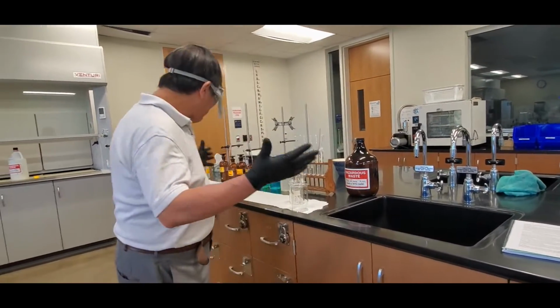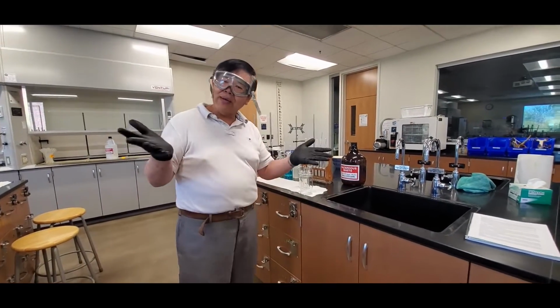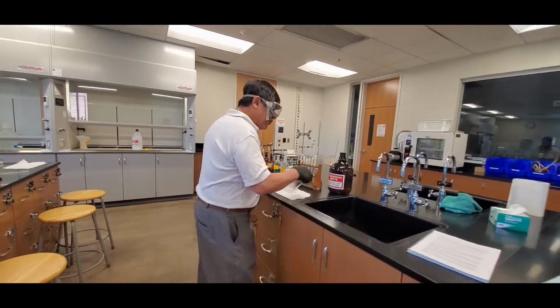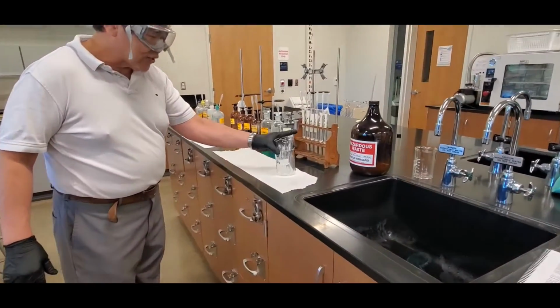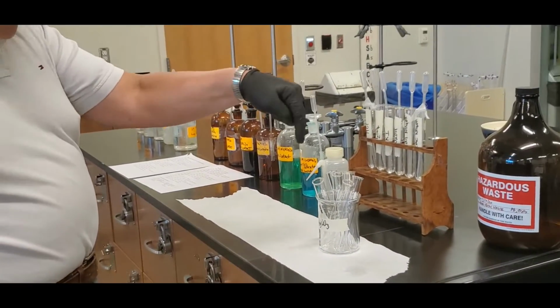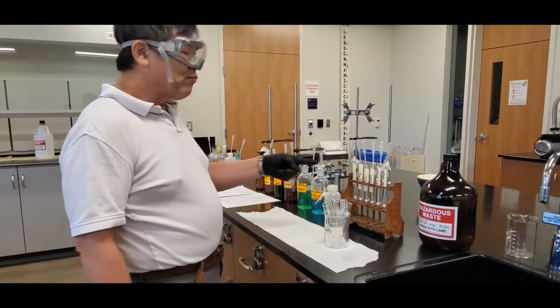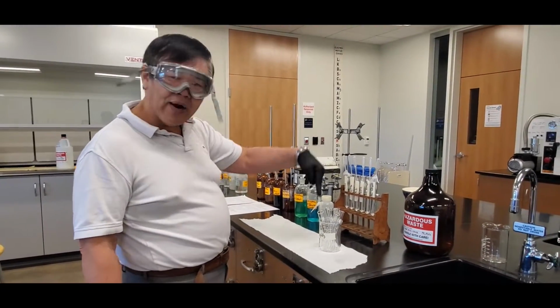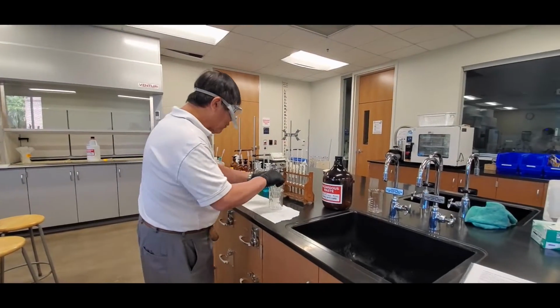So there's the setup. Now I'm going to show you guys how easy it is to do, okay? So don't sweat. The first thing you do is the silver test. There'll be 1 squirt of the silver nitrate in each of the 6 test tubes, and then we'll park them over there and squirt from the back to the front and show you the observation. Okay, so here we go.